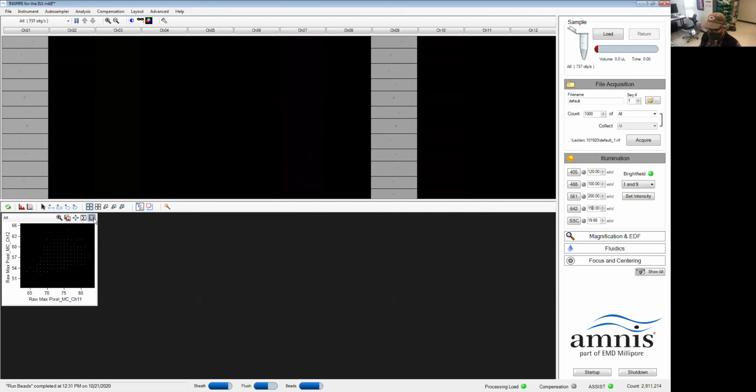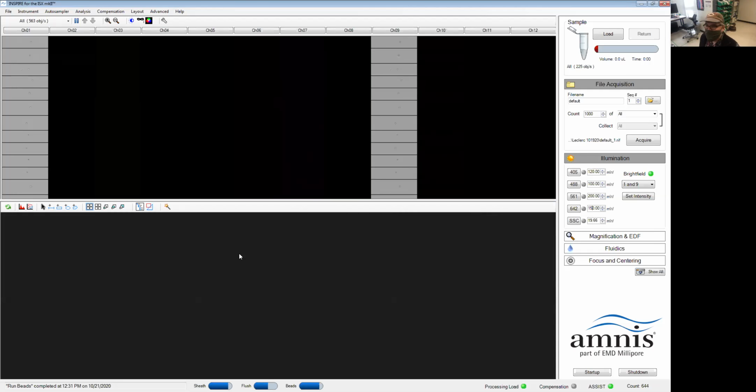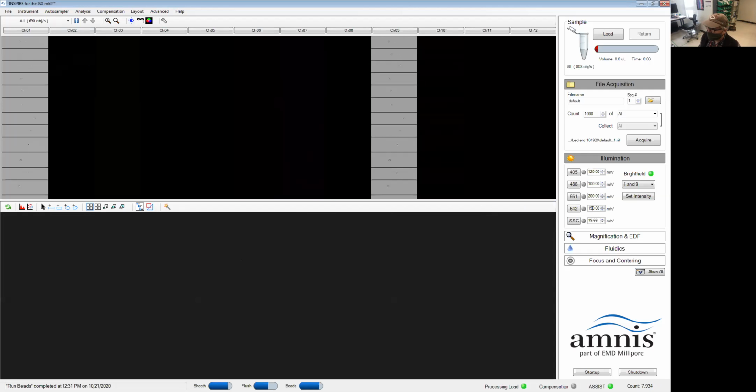So we're going to do a couple of things before we start running our samples. You can see right now the beads are running smoothly, so the speed beads are always continuously running through the instrument. What I want to do before I get started is set up a spot where we're going to save the data that we're going to acquire.